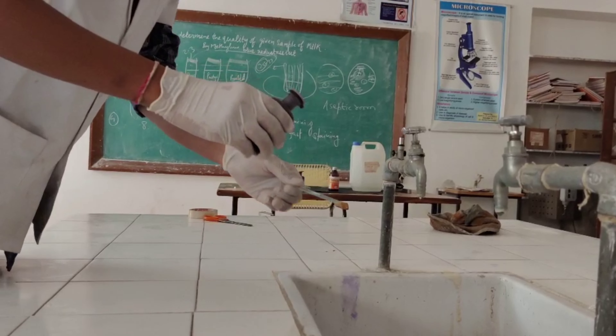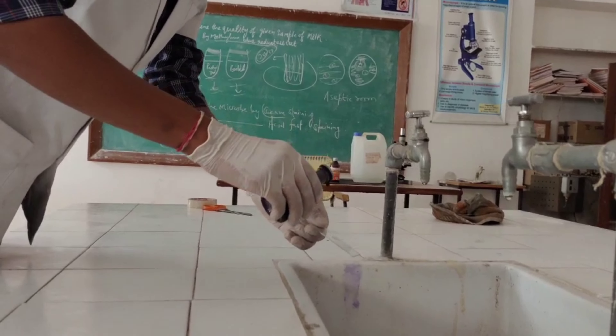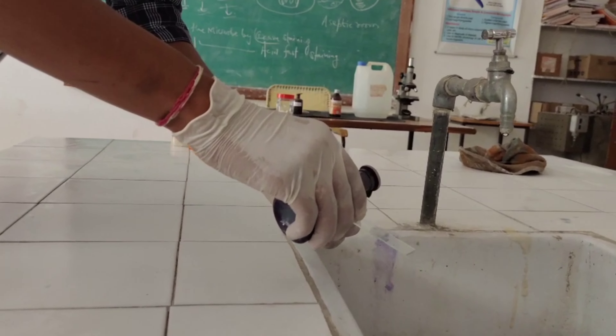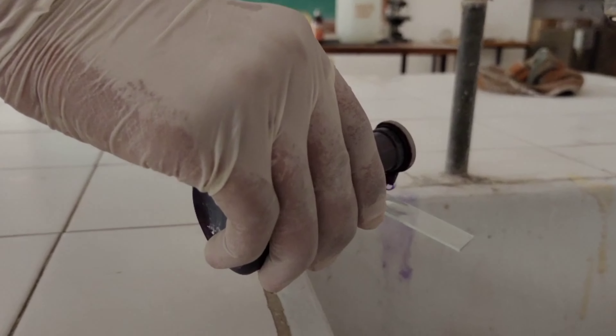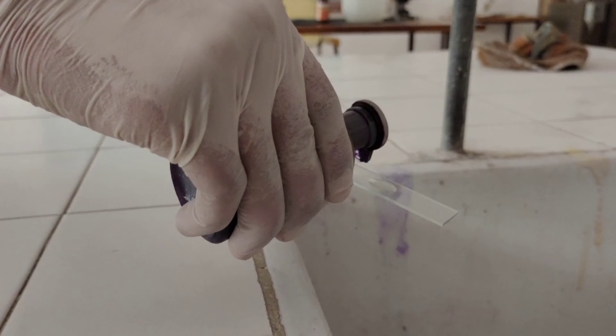After heat fixation, a dye of crystal violet is added to the smear, and it is retained for around 60 seconds.